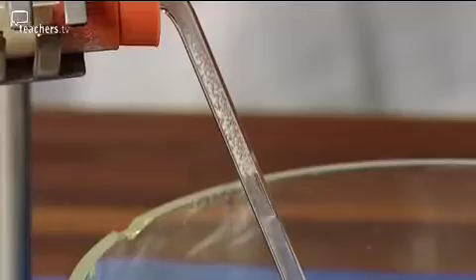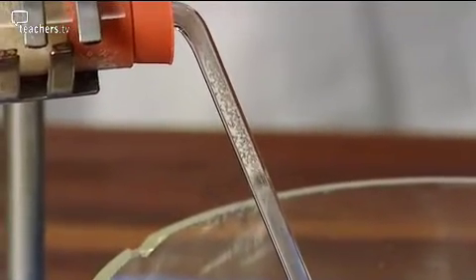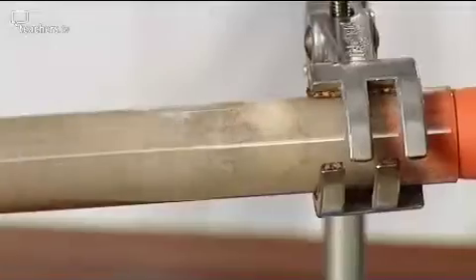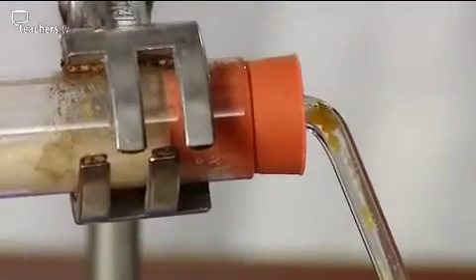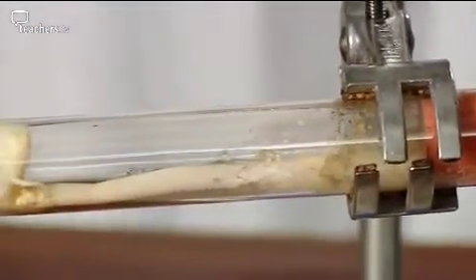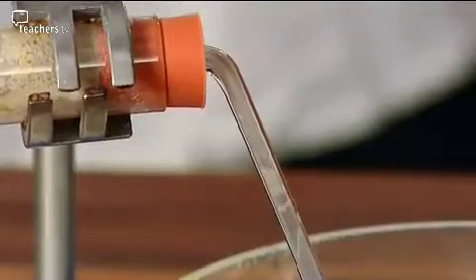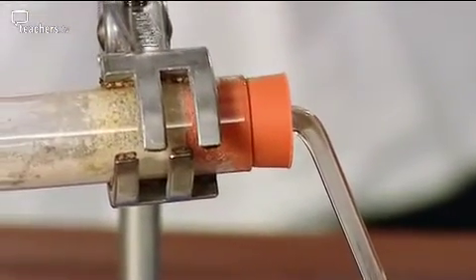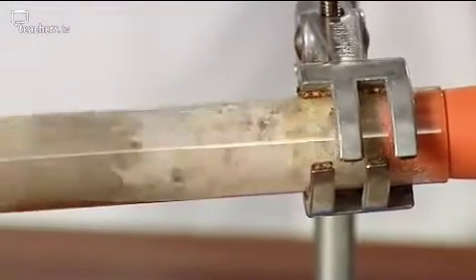Ooh, there seems to be something going back up. It does, doesn't there? Oh dear. Well, that's what happens sometimes with this experiment. It's called suckback. My goodness, so what just happened there? We'd used all the liquid paraffin up, so there was no more gas coming out of the tube. So whatever was left in the tube just cooled down and created a kind of mini vacuum and sucked the water back up into the tube. It was then reacting with the hot material in there and causing a rather strange noise.